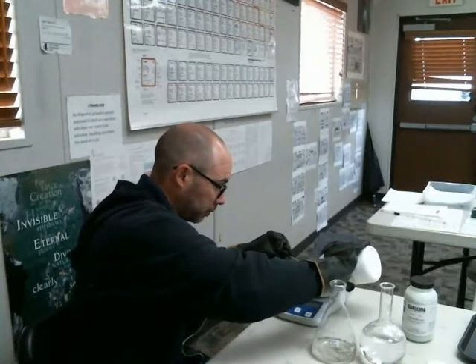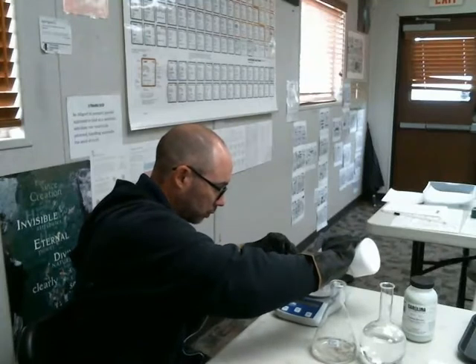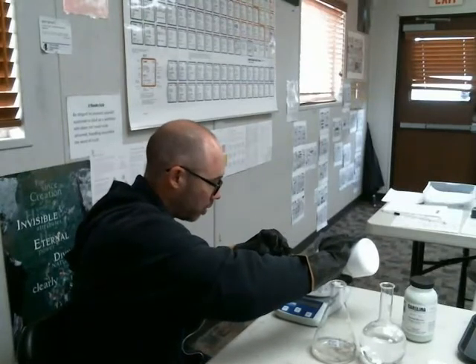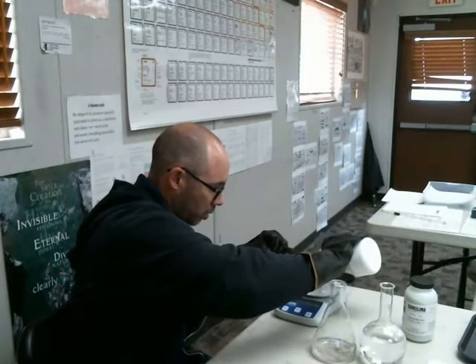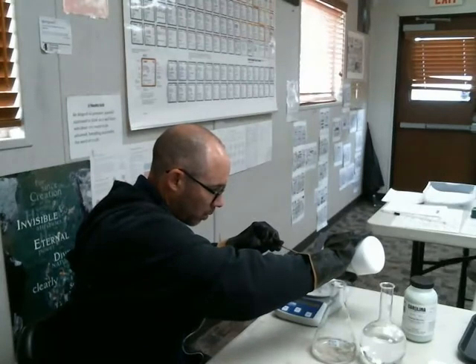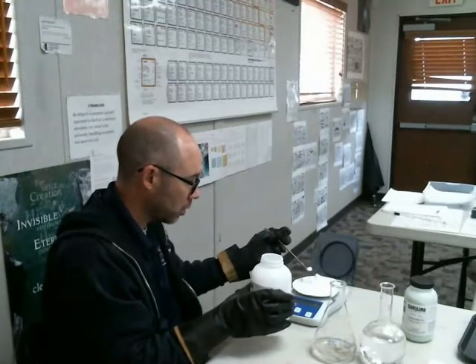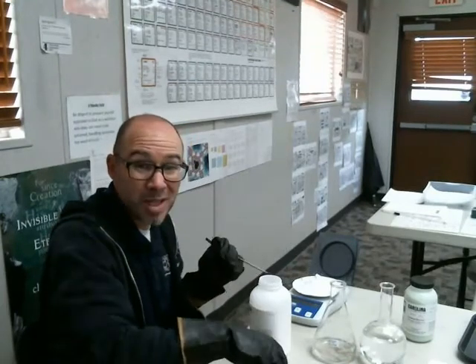A lot. 30, 43. A little bit over. Pinch off. There we go. 43.6.